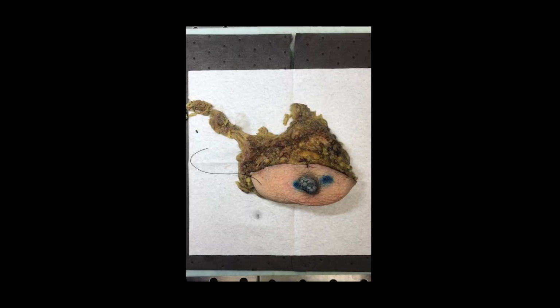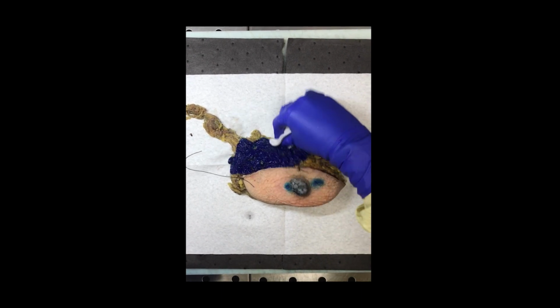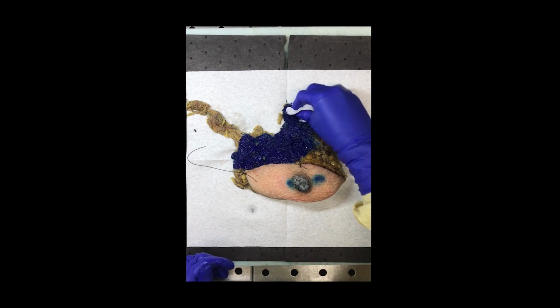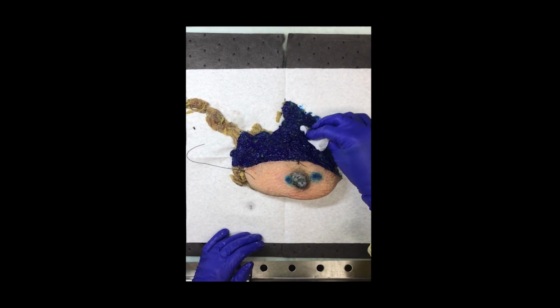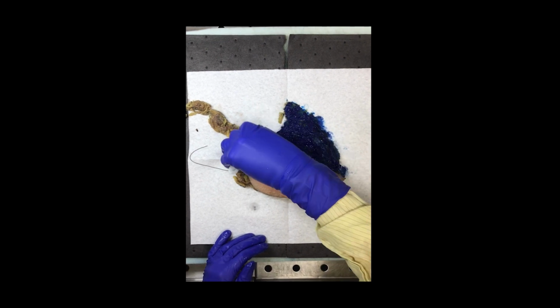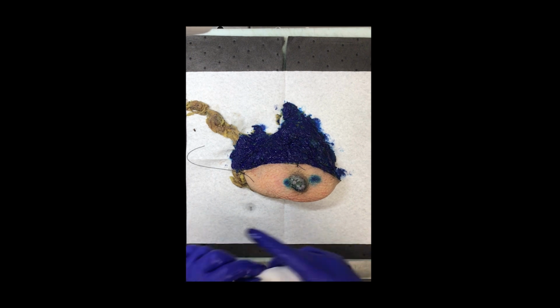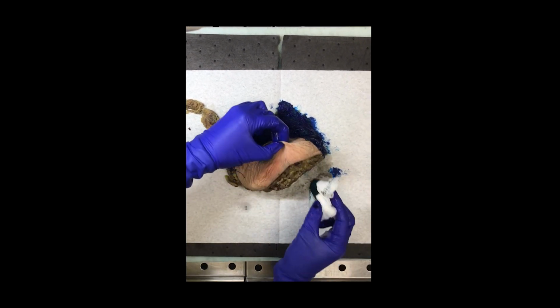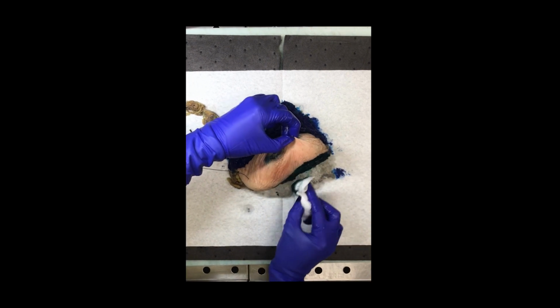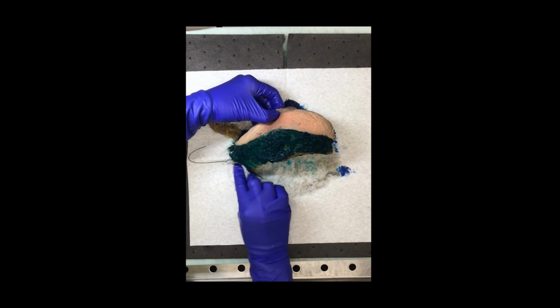So our next step will be inking. So at our institution, we do blue for superior, green for inferior, and black for posterior. If your institution does different inking, just follow the SOP that your institution has. And a good way for us to remember for our inking is blue is for sky, green for grass, and then black is just posterior.